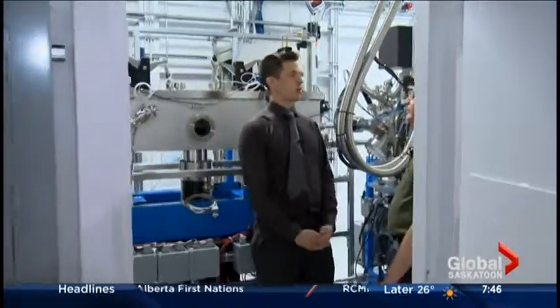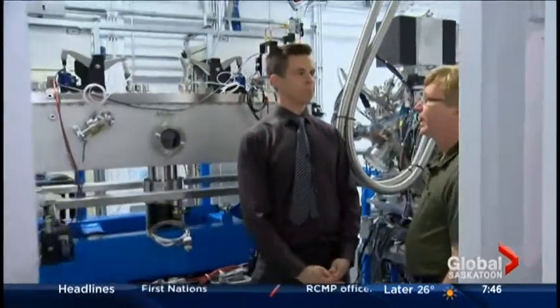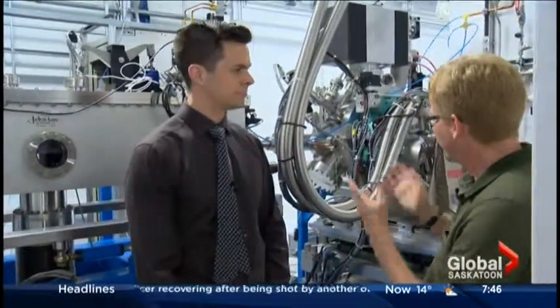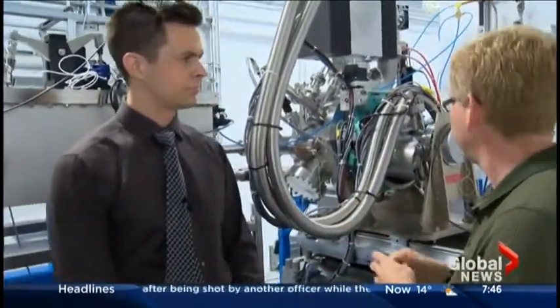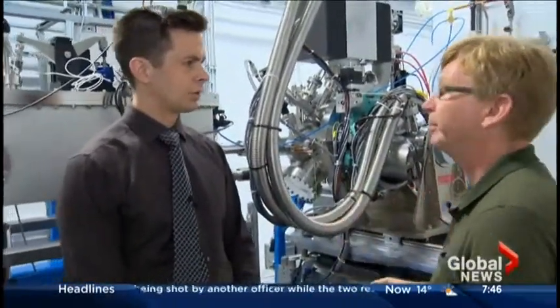There's a lot going on in here. Absolutely — we're inside one of our new beamlines, actually a beamline that's under construction. It's called the BioXAS beamline, and we're getting to see some of the really cool components that make up a beamline.